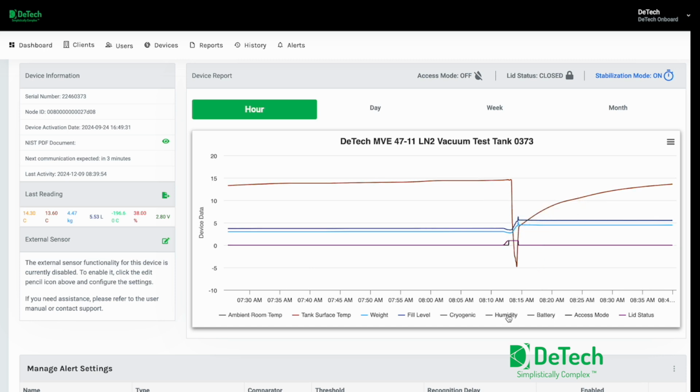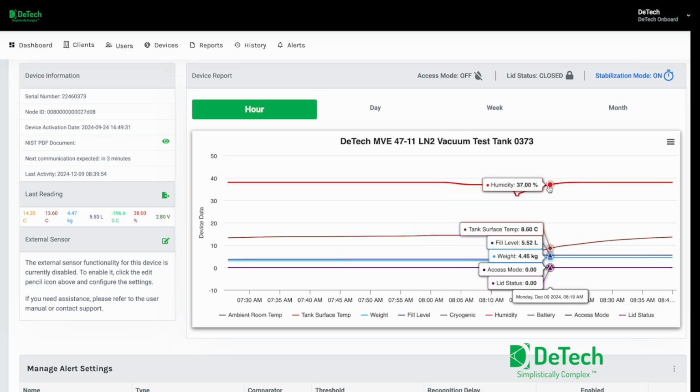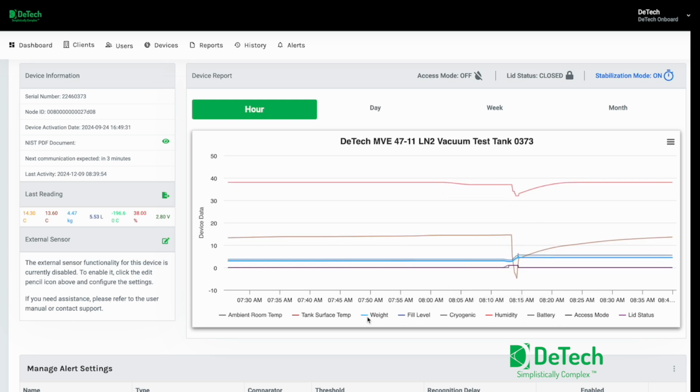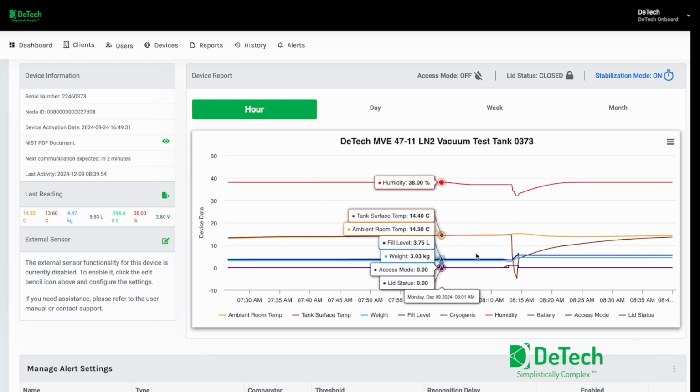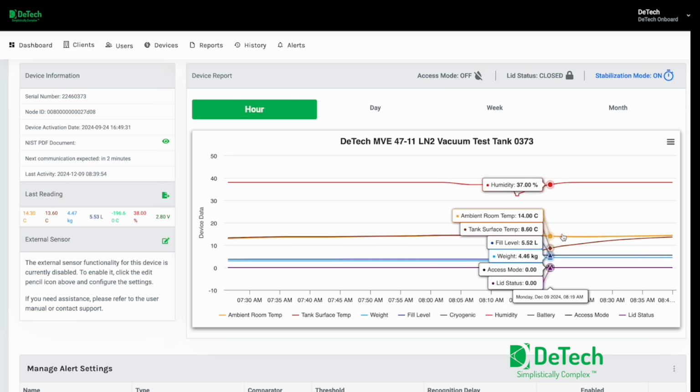And then also, interestingly, is the humidity. We've noticed that if the tank fails, humidity plays an important role, so we can also use humidity as an indicator for tank failure. Or, you can use it just to identify the humidity in the laboratory. The other option is we can look at the ambient room temperature, which is here, and you can see after we started filling it, the ambient temperature started to drop a little bit, which would be expected because our device is mounted to the side of the tank and it's dropping the ambient temperature around our device.